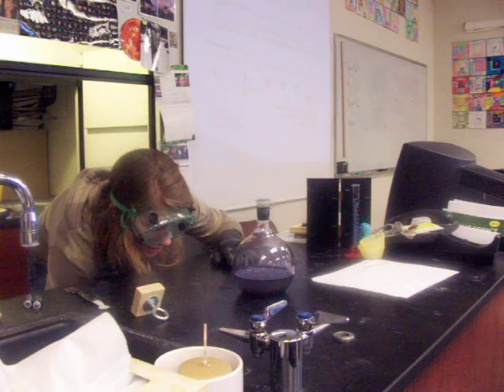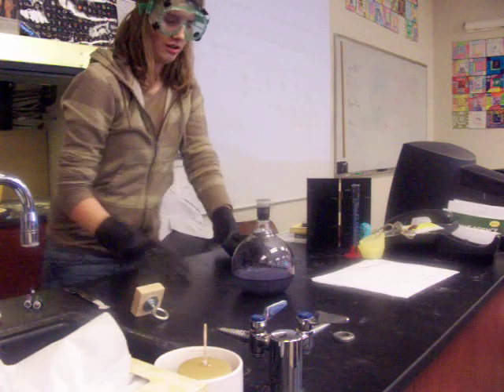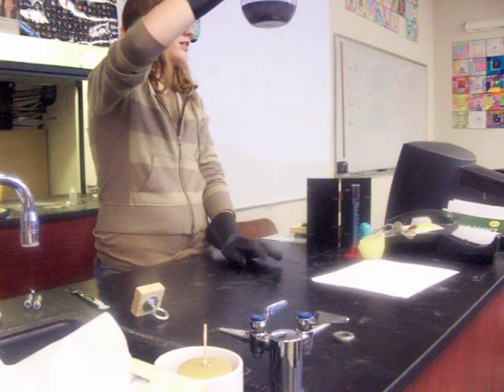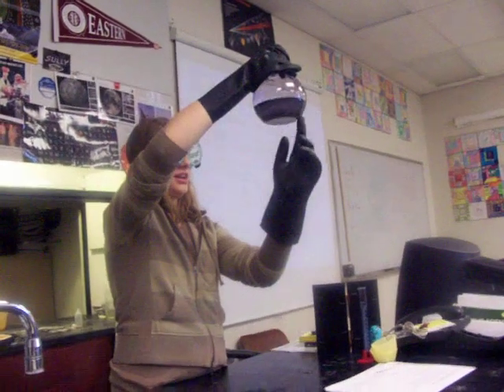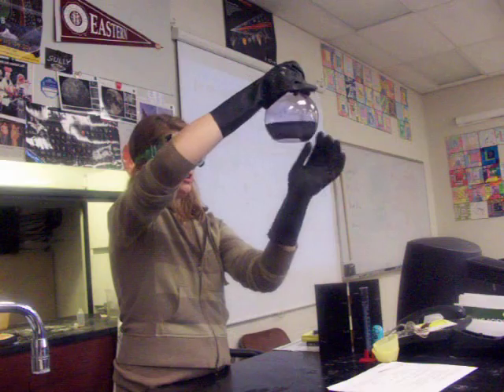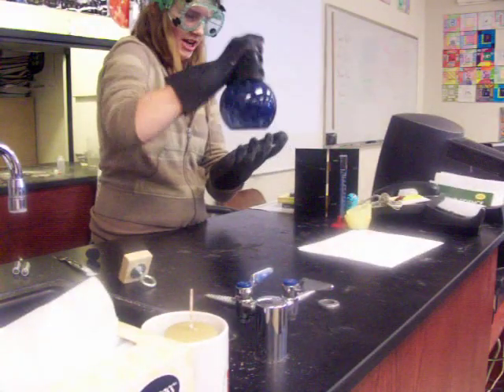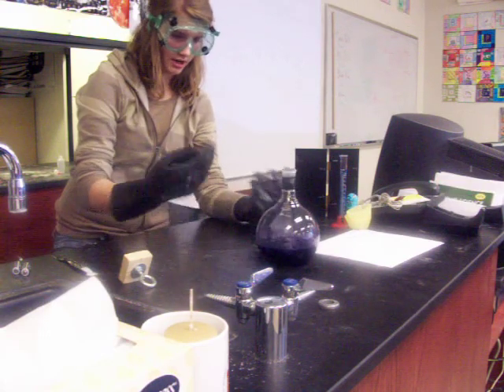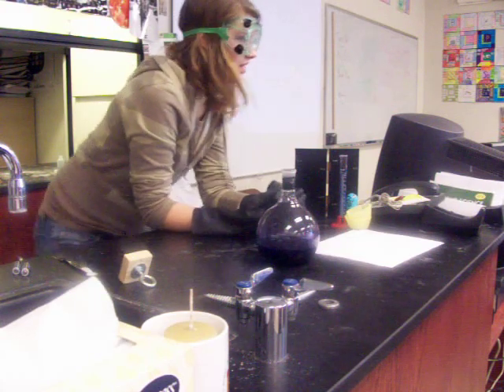What we can do is go ahead and try the next part — just shake it and go back to blue to see how quickly it goes back to clear. Ladies and gentlemen, there's a lot of black solids on the bottom and a little bit of blue, but it turns clearer in the middle. It takes a while for the solids to dissolve. But when you shake it, because of the redox reaction, the methylene blue turns it back to blue. And the longer you do it, the quicker it turns back to clear and back to blue because the solids are more dissolved.